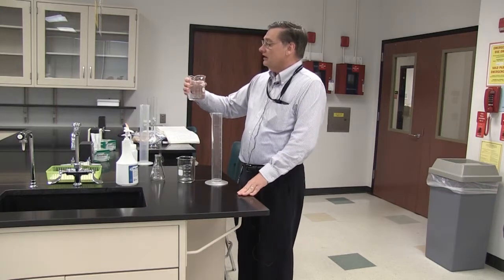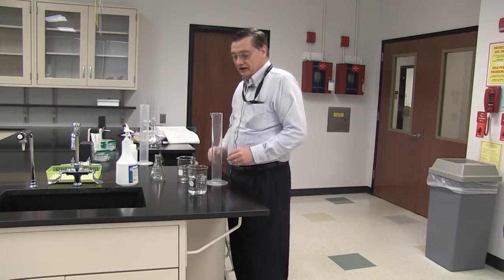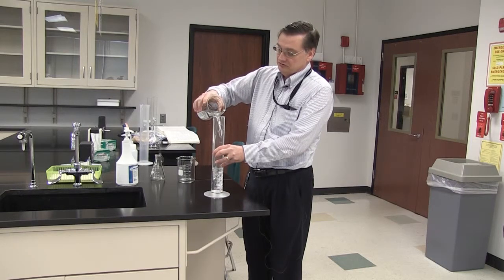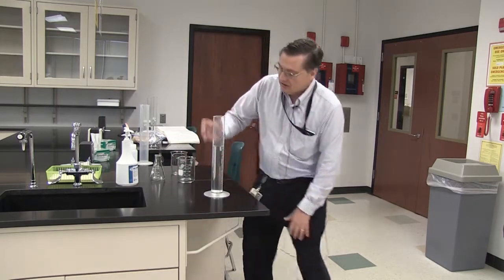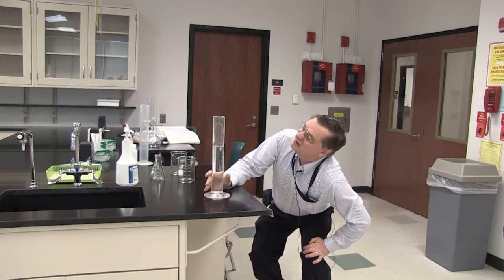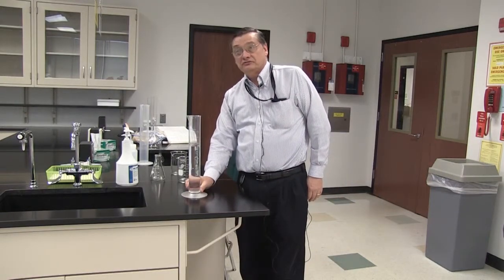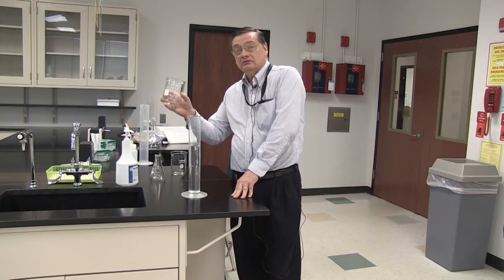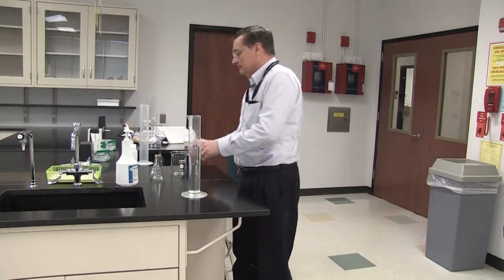So, case in point, I have a 600 mil beaker here that I've measured, where I put it to where it says there are 400 mils of liquid. I'm going to transfer this to a graduate and see what the graduate tells me. Oh, the graduate tells me there are 380 milliliters in there. So I would have made an error in my solution by using a beaker as a measuring device.